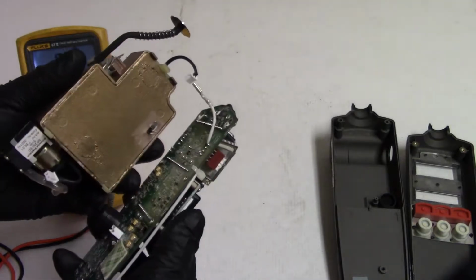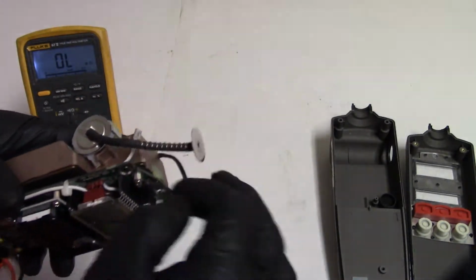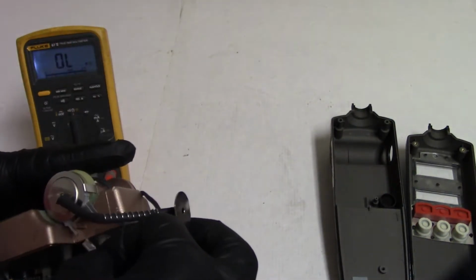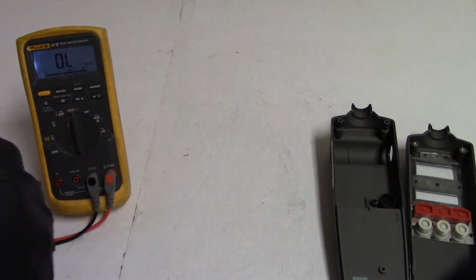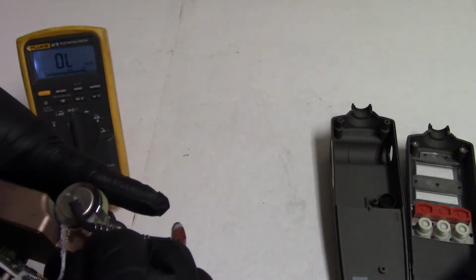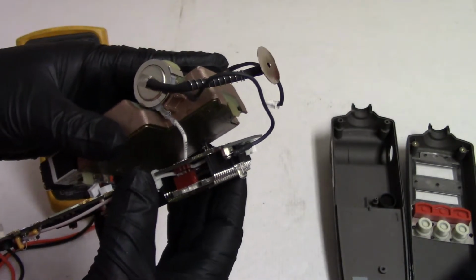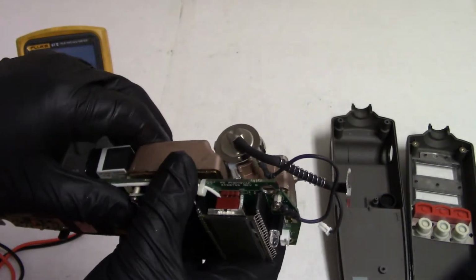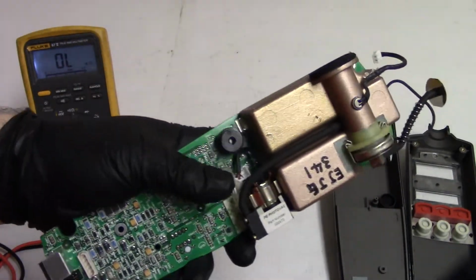So let's put this back on here. You can see those two holes. That lines up. And then let's see, our high voltage goes there. And then the ground wire goes here. Here we are. Let's just bring that all back down. Make sure those pins are still lined up. There we are. Let's snap back down. Let's get our pump plugged back in.